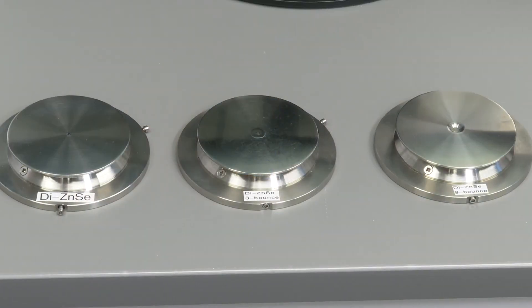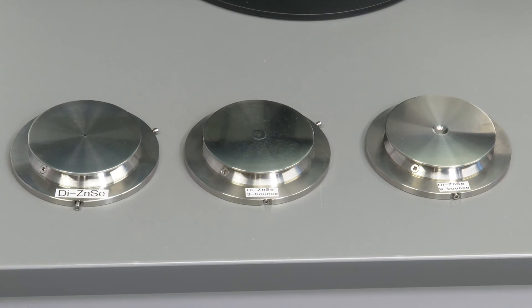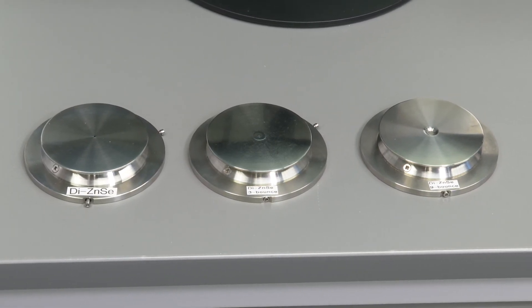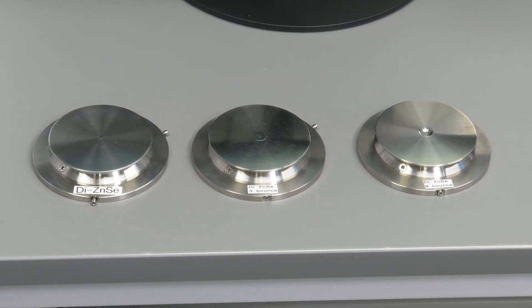The last aspect is going to be your sensitivity, which is going to take into account the number of bounces. The more bounces you have, the more absorption you get, therefore enhancing small features. This could be anywhere from a 1 bounce, to a 3 bounce, to a 9 bounce ATR, or even moving up to an HATR, which can have up to 20 or more bounces.